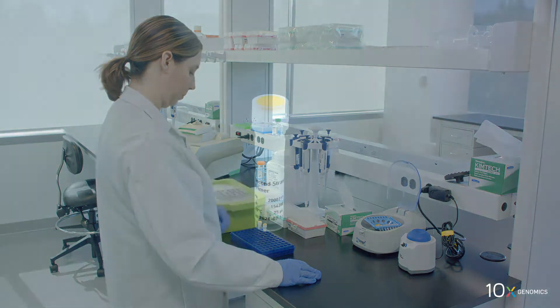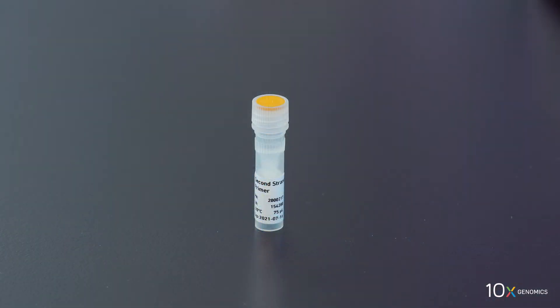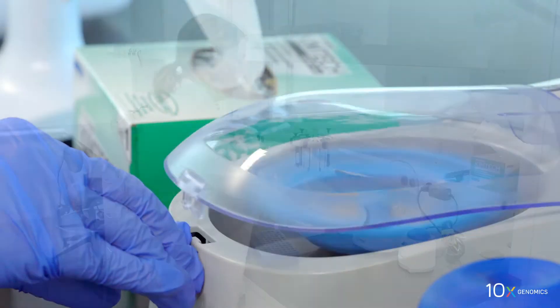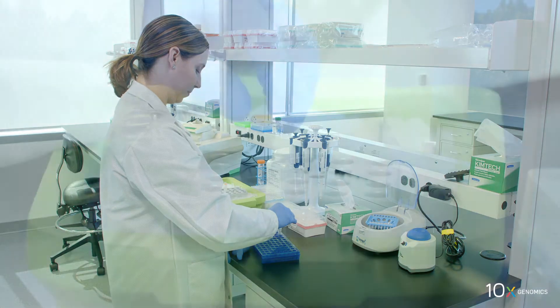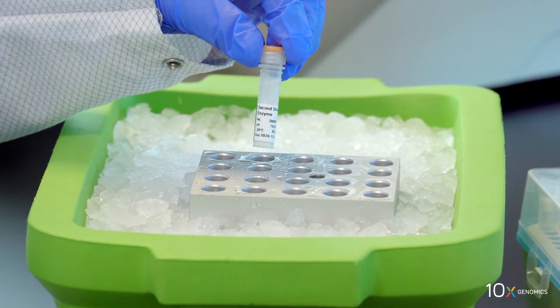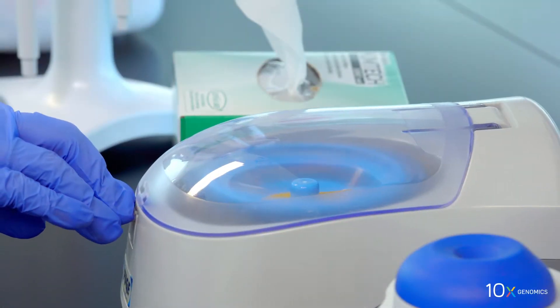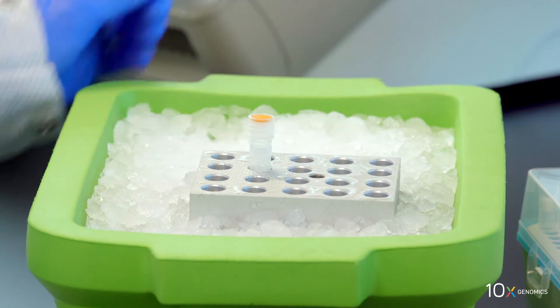We have second strand primer — thaw, vortex, spin down briefly, and equilibrate to room temperature. We have second strand enzyme on ice. Pipette mix, spin down briefly, and place on ice before adding to the mix.